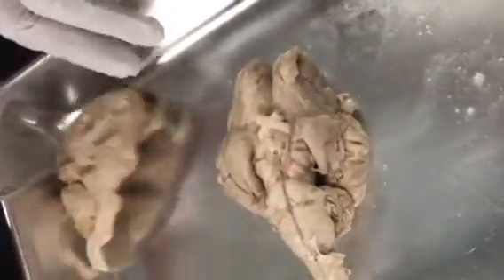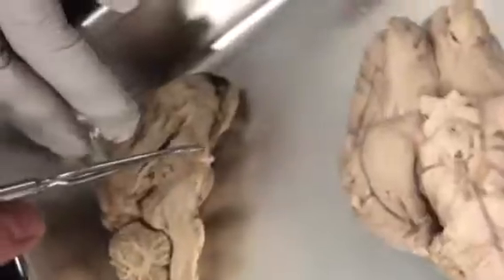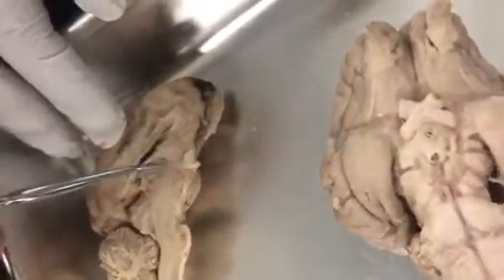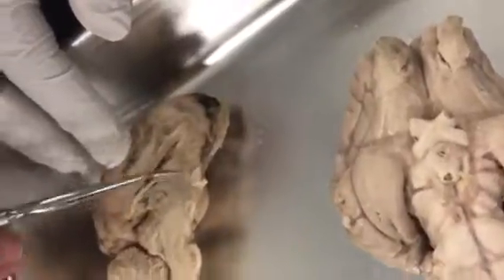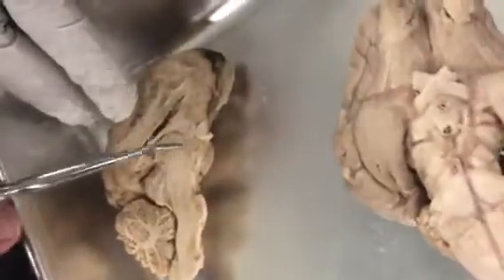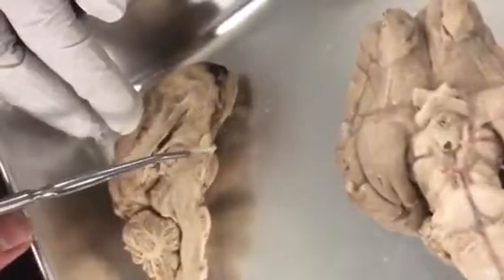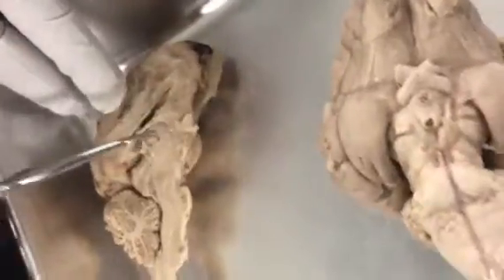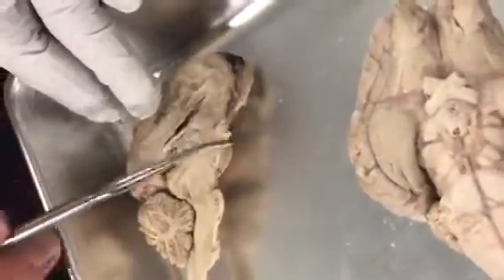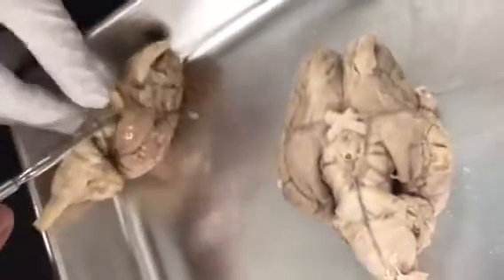Now, we can see the chiasm on here as well. Right here. See that? It's right below this. What is this? Hypothalamus. Don't confuse them. But the neat thing is, they go in a row. You got optic chiasm, hypothalamus, thalamus, pineal gland. They run straight together.